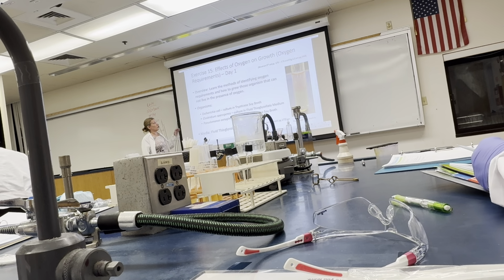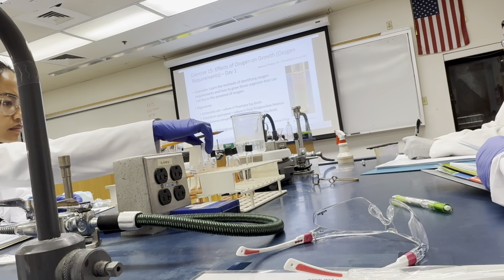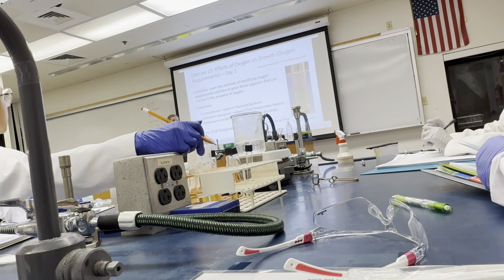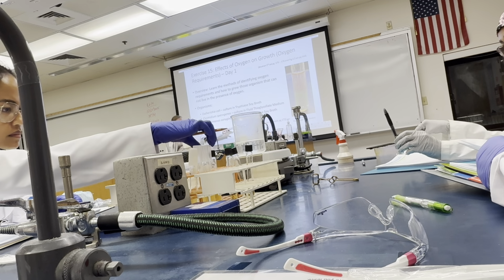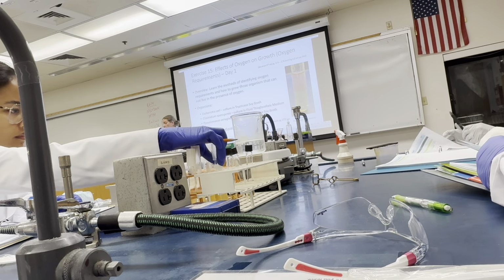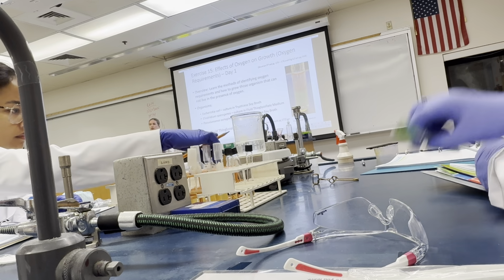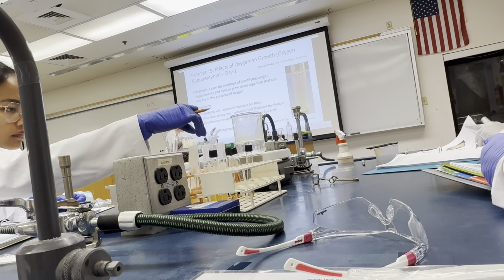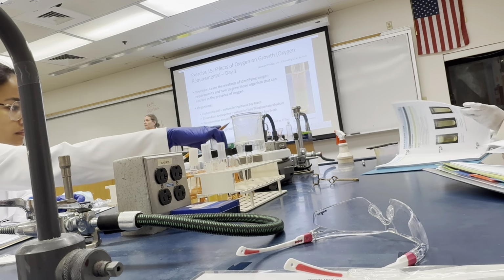At your table, you have 3 organisms: Escherichia coli, Clostridium sporogenes, and Pseudomonas aeruginosa. We're going to inoculate these 3 organisms into their own tube of fluid thioglycolate medium. Again, this is one we will do for the unknown, so page 172 also shows this media in a lot of good detail, all wrapped up in one page. One of the requirements of this media is that you have to boil it first, for 5 minutes, and let it cool.